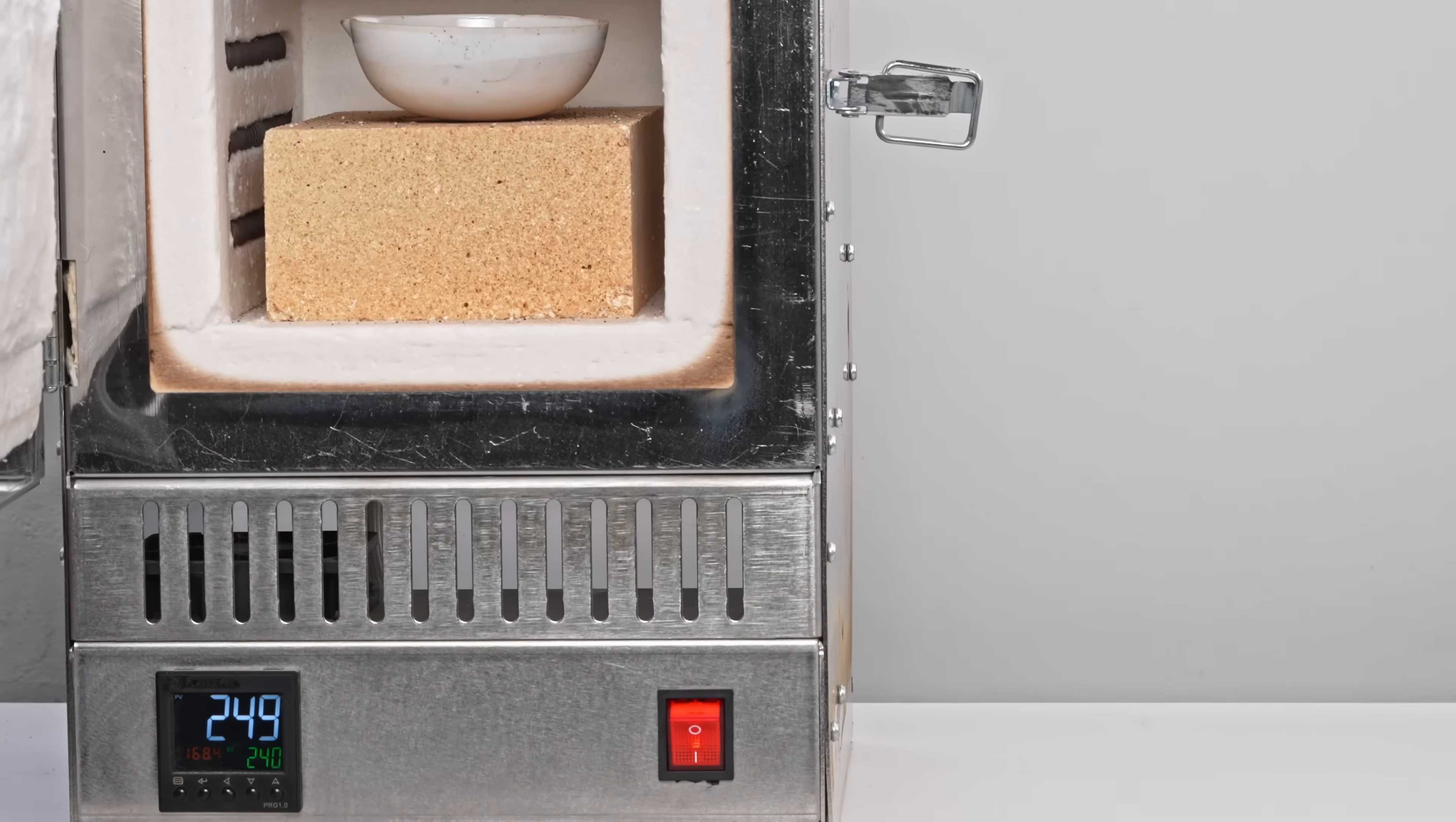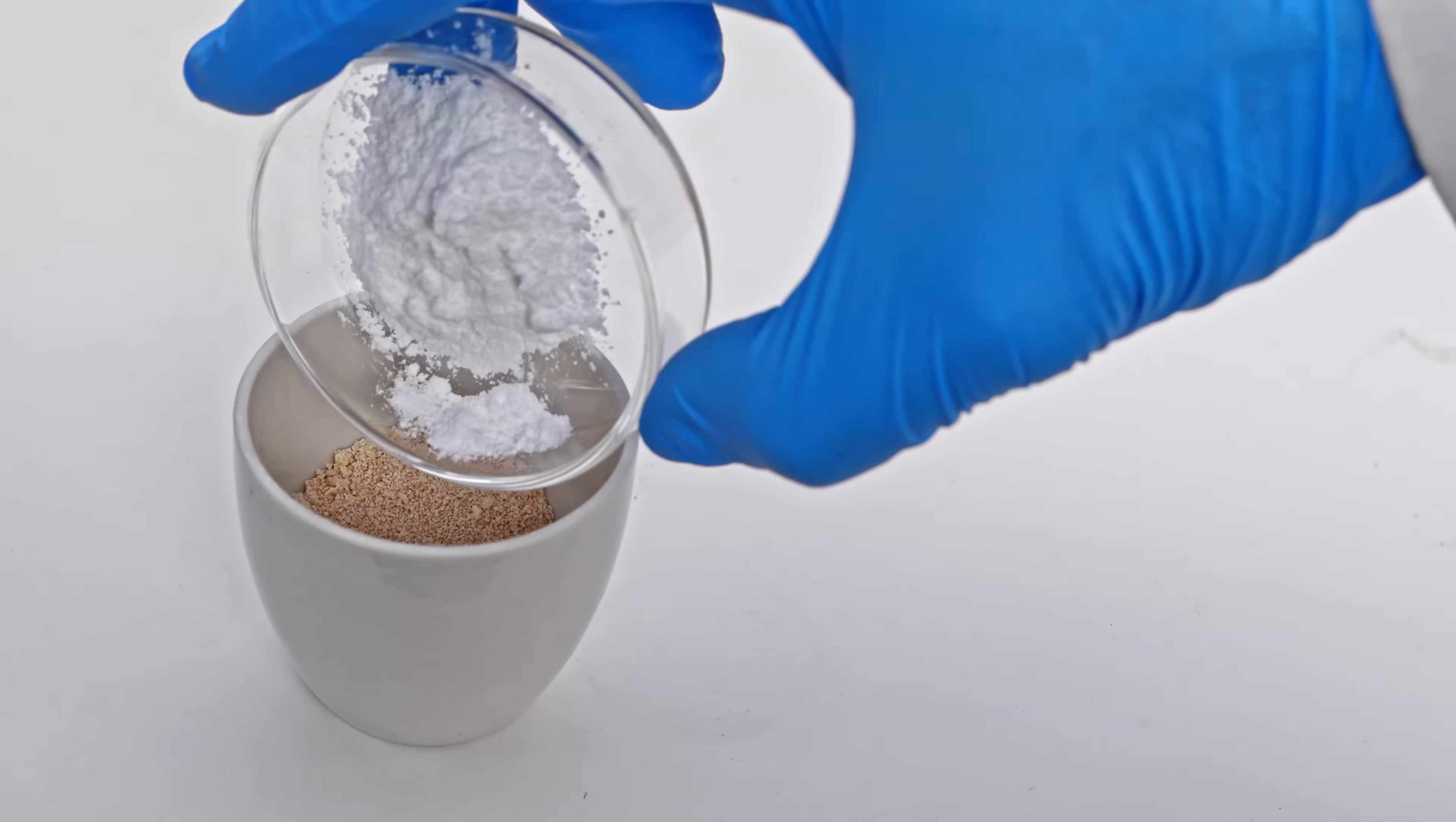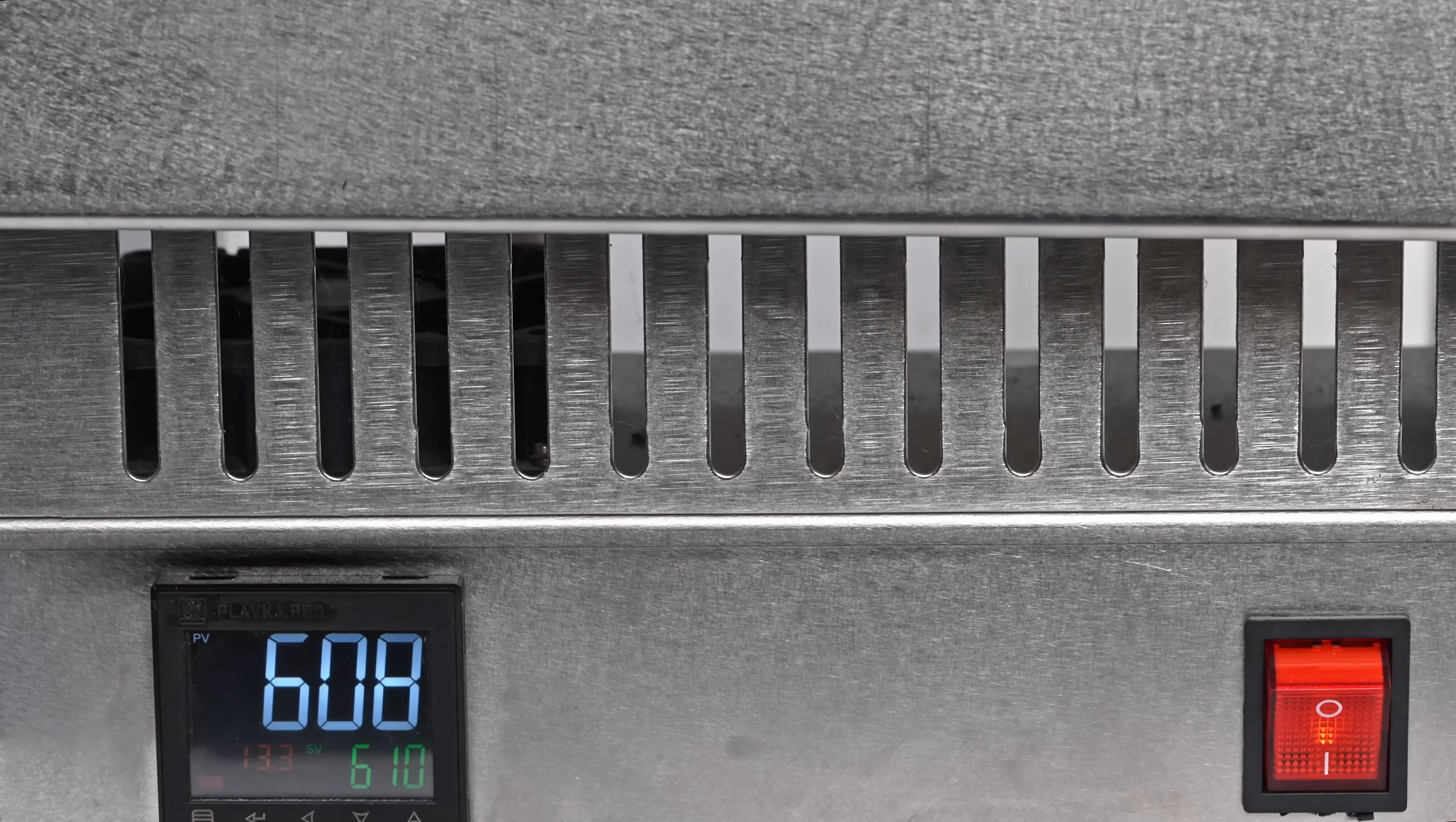This has a pale brown color compared to its yellow hydrated form. To obtain potassium cyanide from this salt, I'll add to it the calculated amount of potassium carbonate. I'll mix it well and put this mixture in a muffle furnace at 600 degrees Celsius for some time.